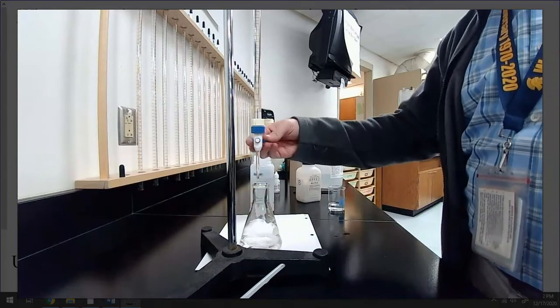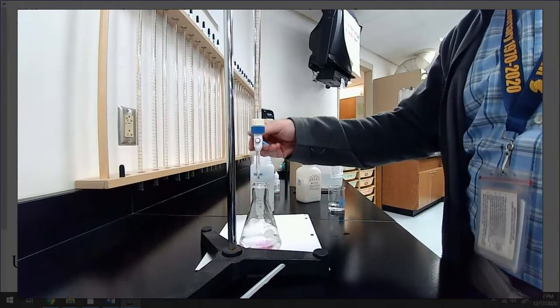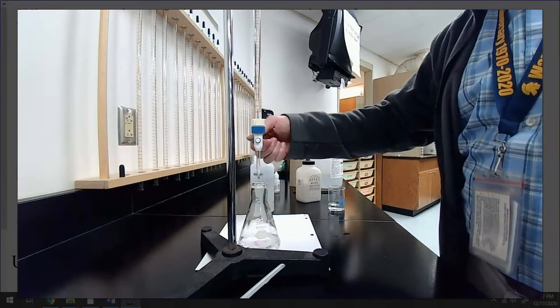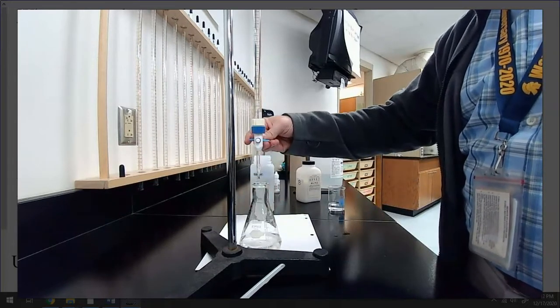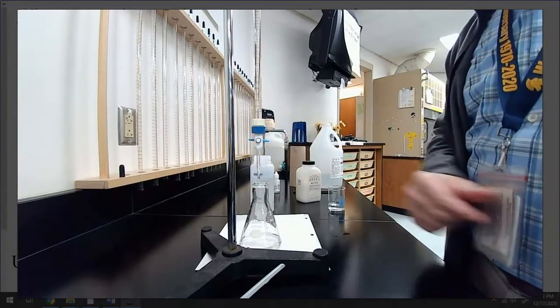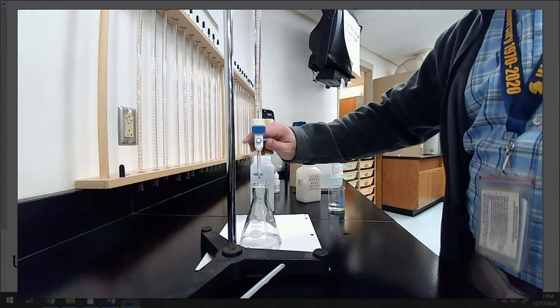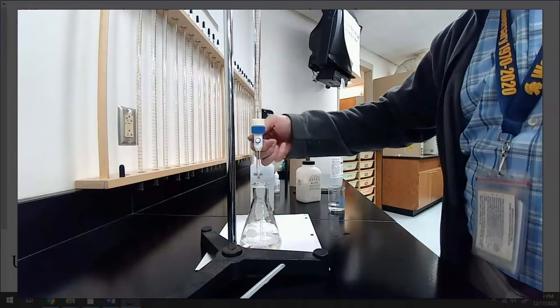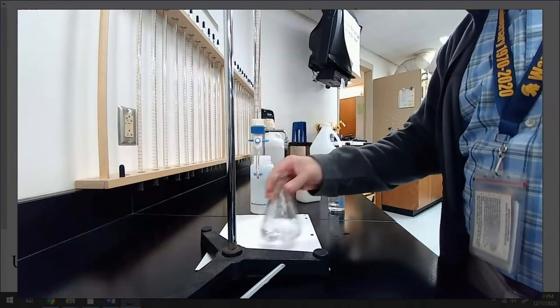It's hard to tell if it's close or not. And you know me, I didn't do any math beforehand. Ooh, I think it's getting pretty close. Now I'm going to use this technique, okay? And I would show you this if you were here. Instead of just opening it up and trying to get one drop to drip, if you do a quick little half turn, it actually is less than a drop. So that is less than a full drop.